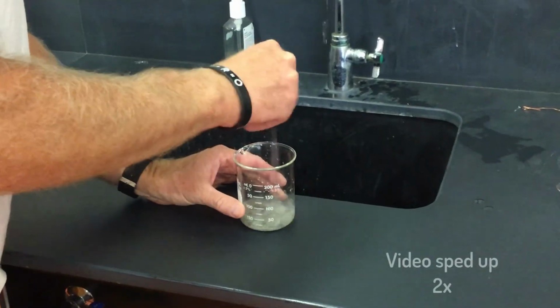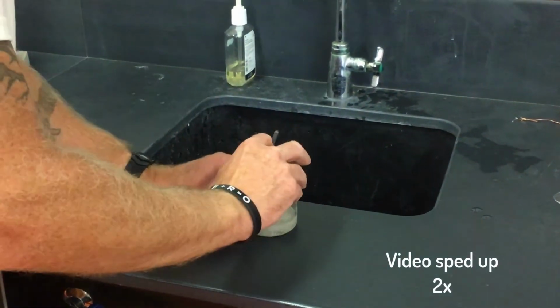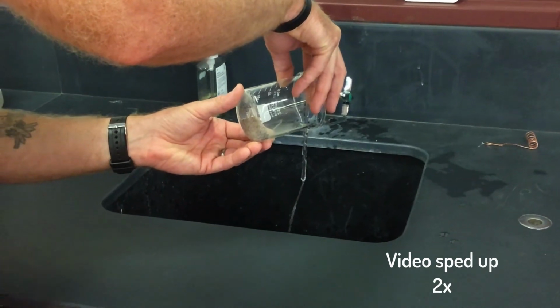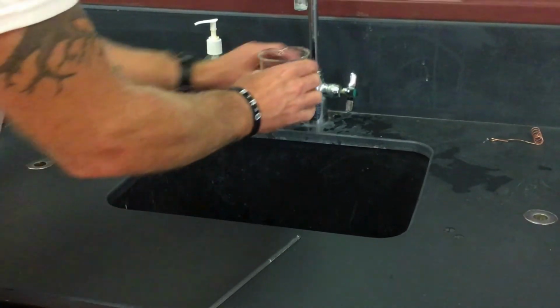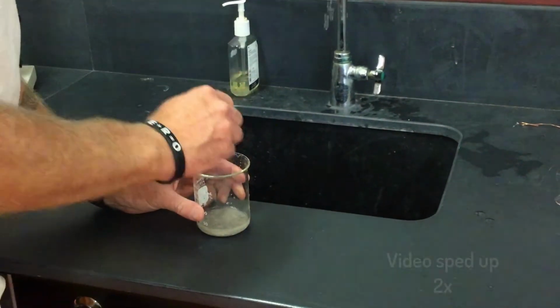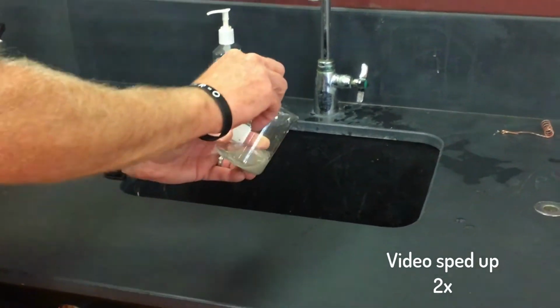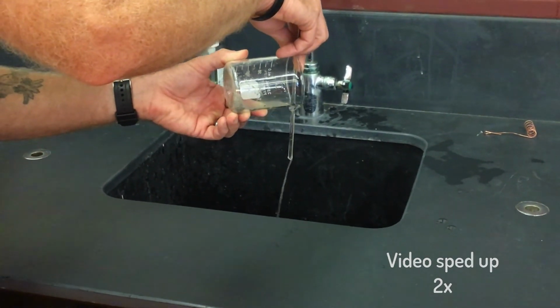Now, rinse the solid in the 250 milliliter beaker with tap water, mix it with a stirring rod, let the solid settle and decant the rinse water down the sink. Then repeat this process one more time before placing the 250 milliliter beaker in the oven to dry out the solid crystals, and the 150 milliliter beaker under the heat lamps to evaporate all the water from the solution.